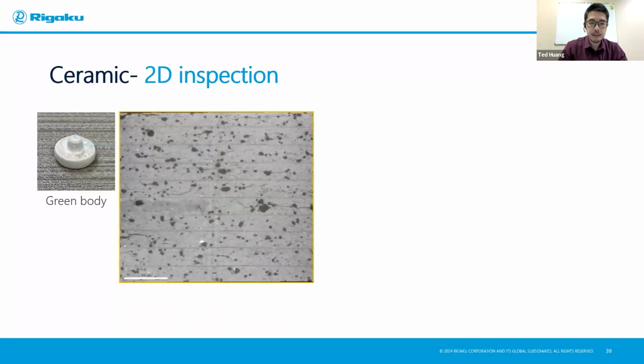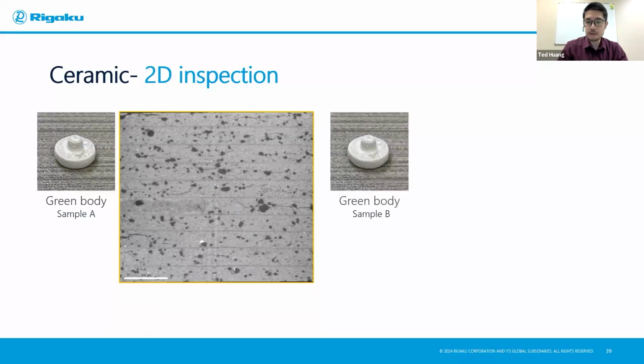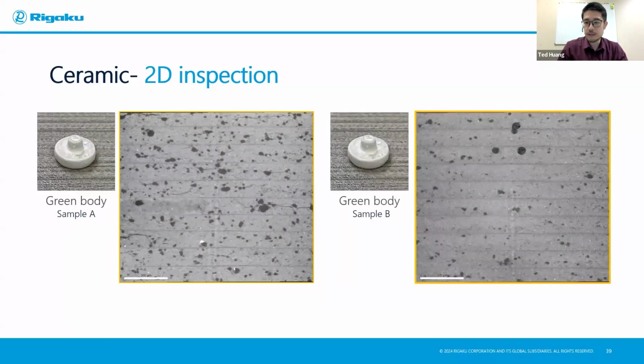And what we're seeing here on the left is like this. You can see clearly different layers of the sheets laminated together and some of the phases, secondary phases that are inside. And just for a comparison, this is one of the samples, sample A with certain composition. For another sample, that's sample B on the right side. You can see clearly the difference between them in terms of how the second phase is distributed and the existence of some cracks in one and a lack thereof in the other.